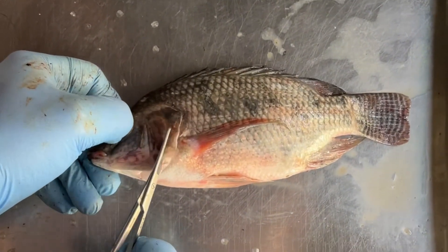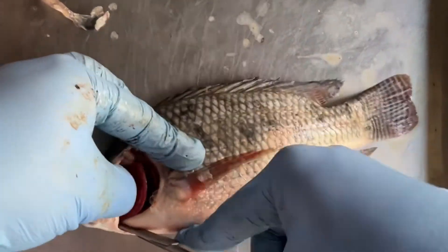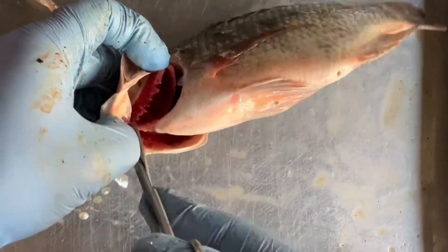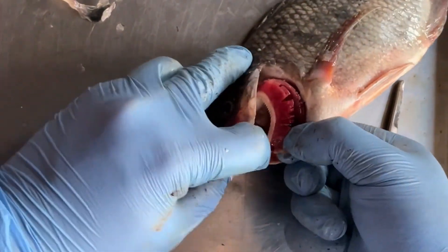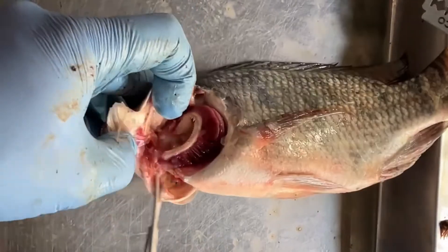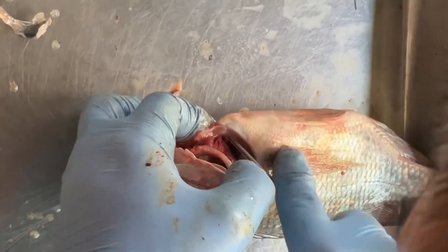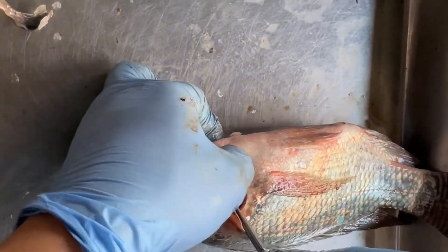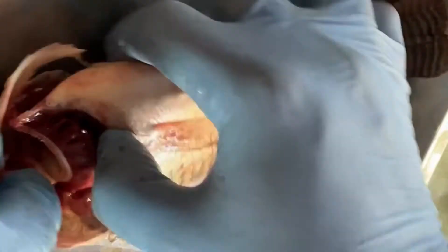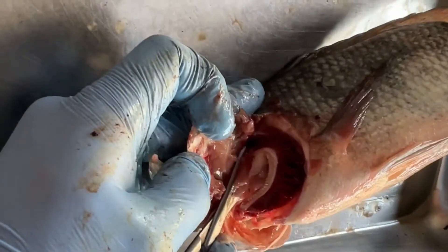When dissecting a tilapia fish and removing the gills, it is important to carefully preserve the integrity of the specimen. Identify the operculum, which is a bony covering protecting the gills, located on either side of the head just behind the eye. Use scissors to carefully make a cut along the edge of the operculum, then gently lift the cut edge using forceps or a probe to expose the gills beneath. Once the operculum is open, observe the gill arches and filaments. Use dissecting scissors, forceps, or hands to carefully detach the gills from the gill arches, starting at the posterior end and working towards the anterior end, taking care to avoid damaging the delicate structures. Cut any connective tissues or ligaments holding the gills in place, ensuring they are fully detached.